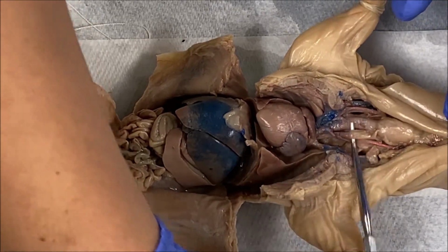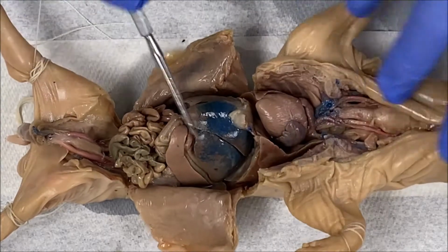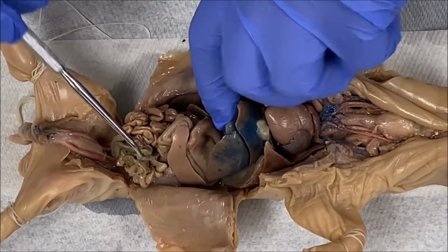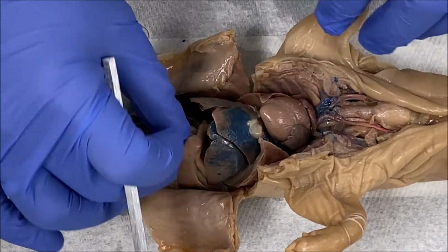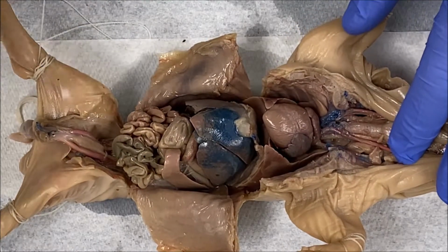So from the esophagus, food then travels to the stomach, right? So the stomach's gonna be located underneath this large internal organ right here. This is the liver. Underneath the liver, again, here's the stomach, okay? And then from the stomach, you have your intestines, right? So this here, these are the small intestines.